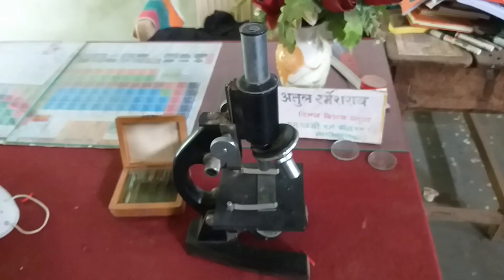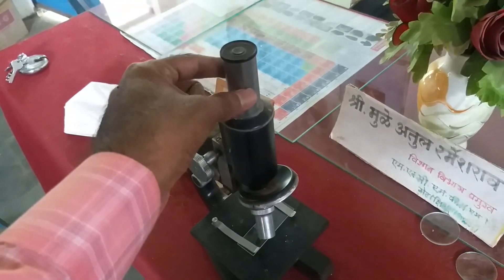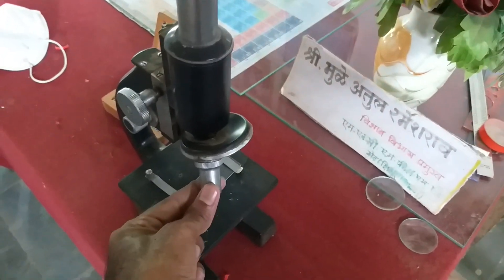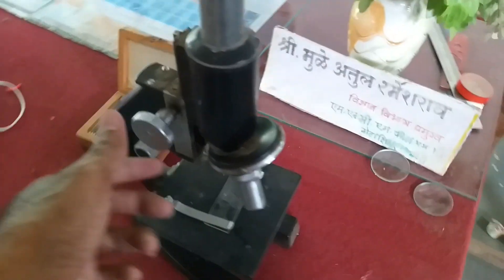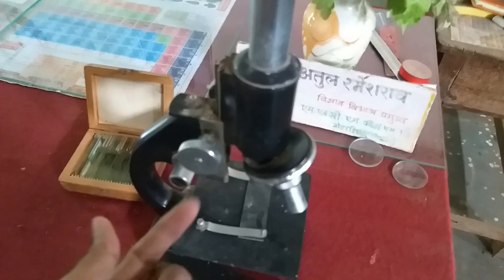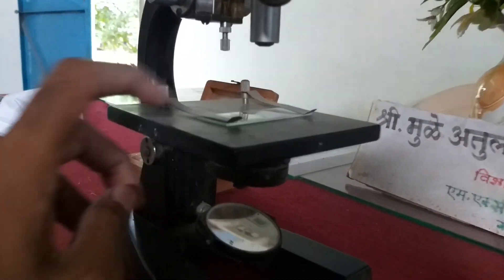We can observe that vibrations are the cause of the production of sound. This is the microscope — this is the eyepiece, this is the objective lens, here is the coarse adjustment and fine adjustment. We put the slide here, and it has a mirror to pass light. We can easily observe slides through the eyepiece.